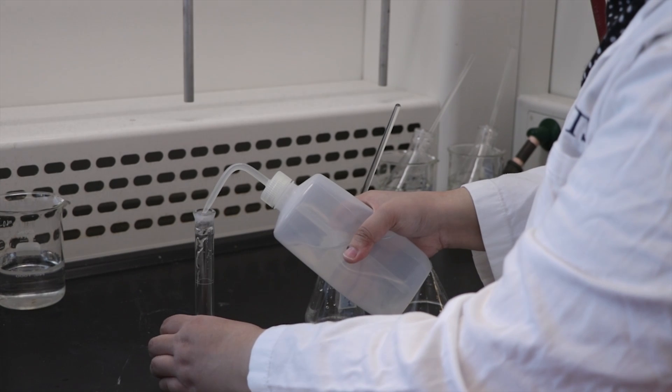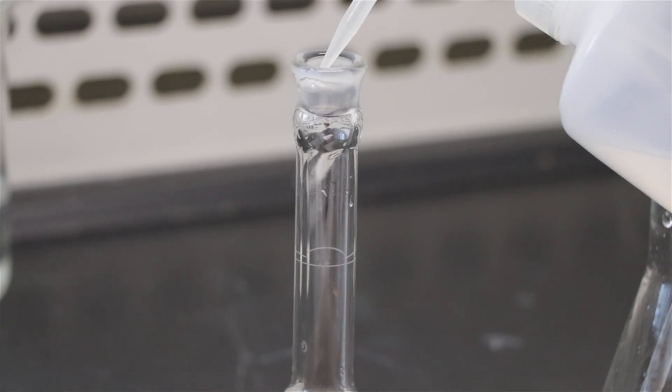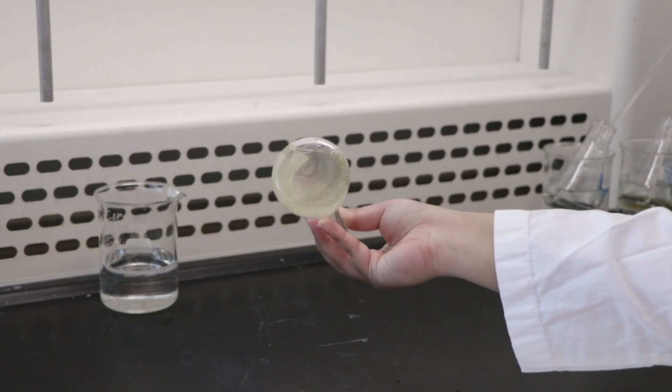Fill the volumetric flask to the mark using distilled water. Stopper and invert the solution 20 times.